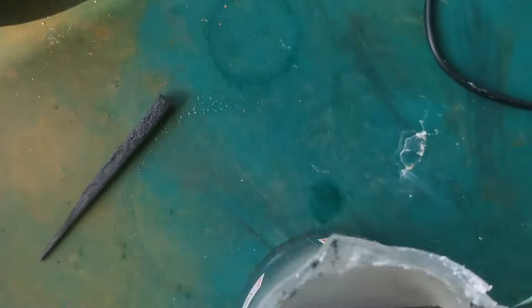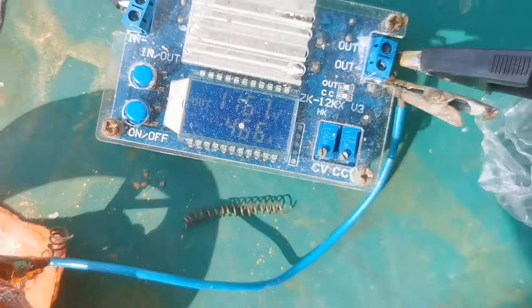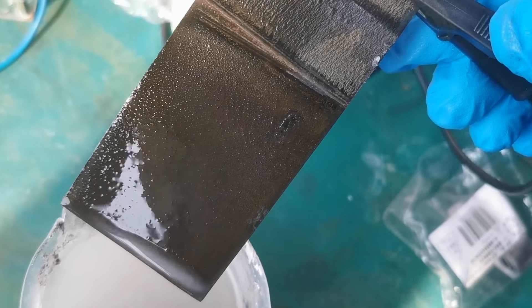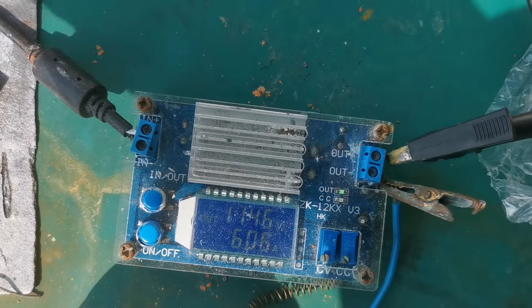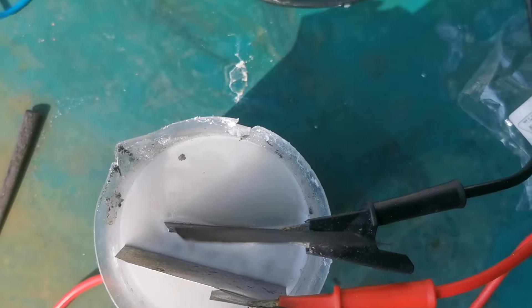So after 20 minutes of testing, I turned up the current to 4.6 amps, and the electrode was still holding surprisingly well. As you can see, there are no apparent surface deformations or cracks. I then decided to really test the electrode's limits and cranked the current to 6 amps, which is the maximum for my power supply.